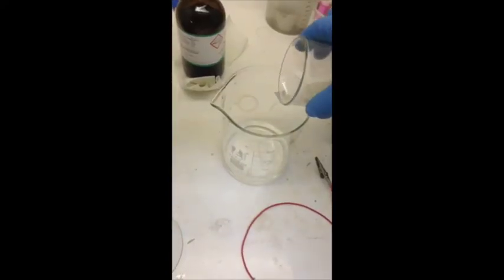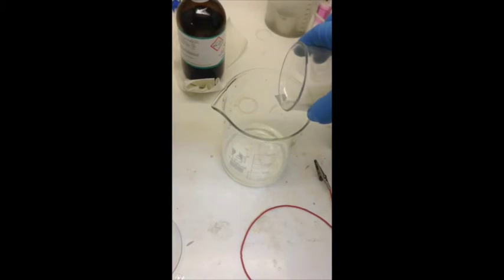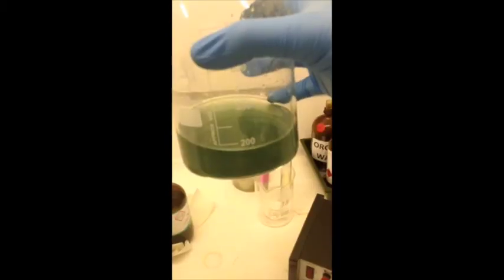Remove from the heat and then add that concentrated acid to a large volume of water.